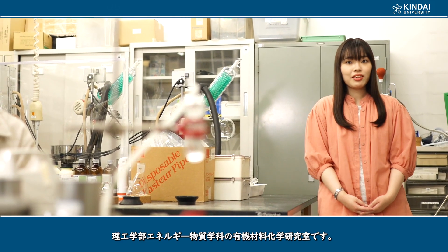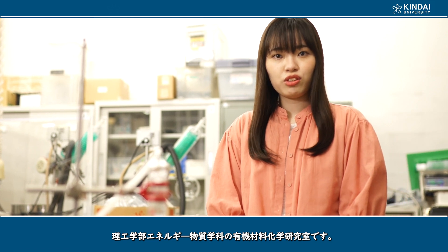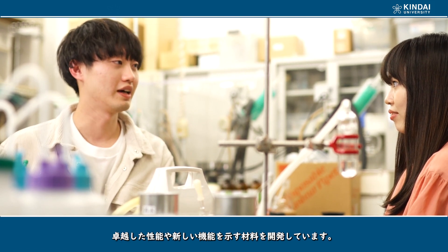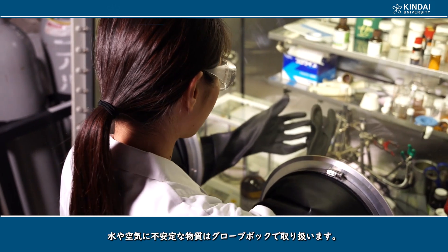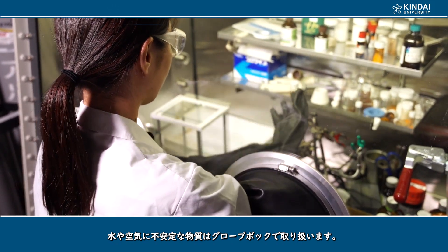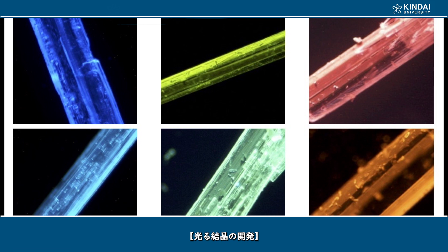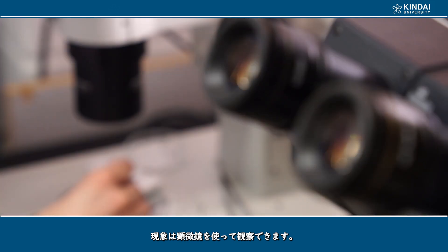This is the Laboratory of Organic Material Chemistry in the Department of Energy and Materials of the Faculty of Science and Engineering, and we study in this laboratory. We are developing materials with outstanding performance and new functions, including materials that are unstable in water or air. We are also developing luminescent crystals and shape-changing crystals, and these phenomena can be observed using a microscope.